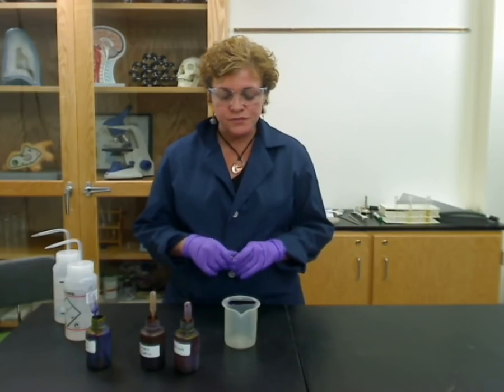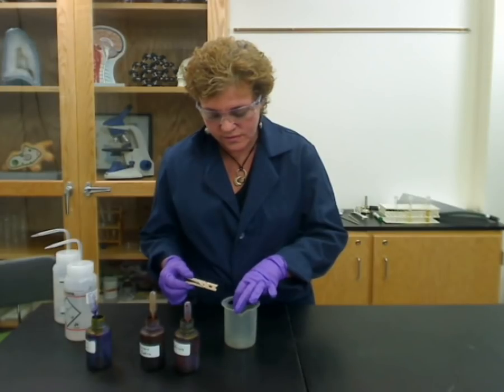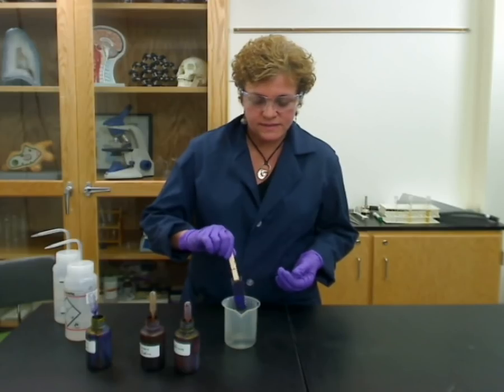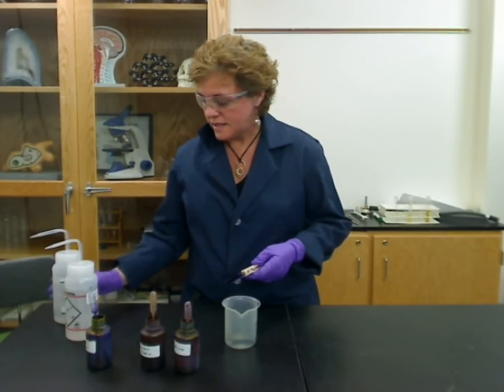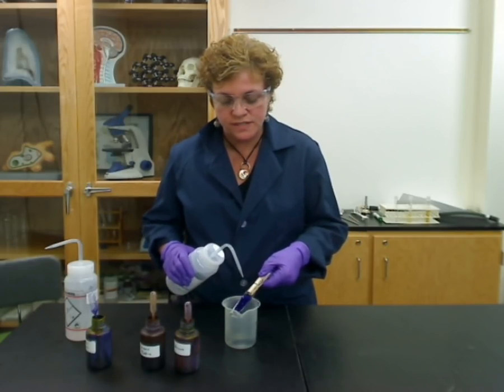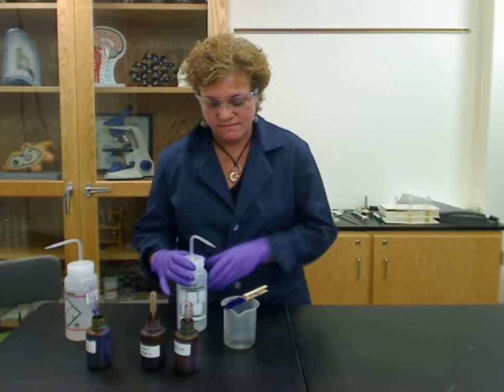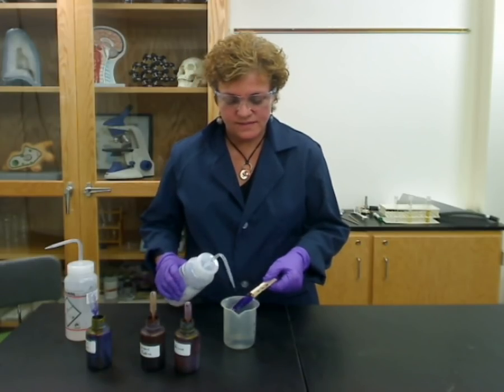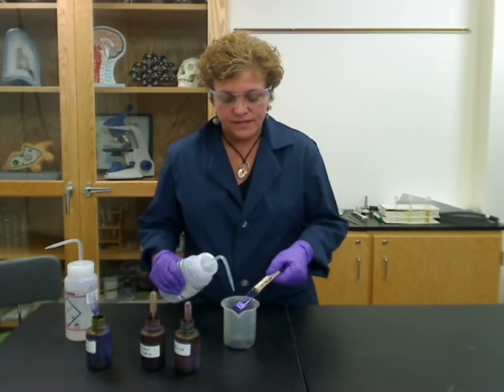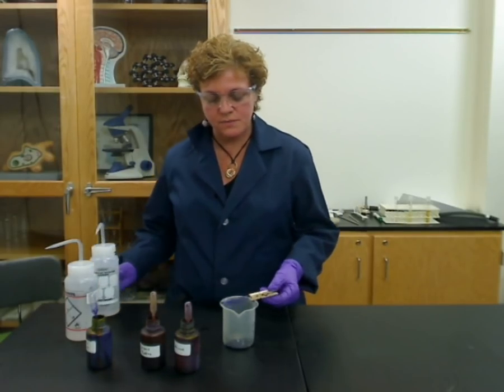After a minute, if you don't have gloves and you don't want to get your hands messy, you can grab it with a clothespin and dump it that way. Then you're going to use plain tap water. If you have a sink available, you can do just a slight stream of water to rinse off that stain, and you should see just a slight purple after that.